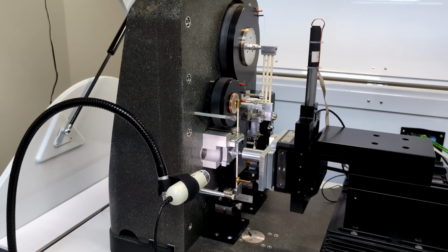As covered in the previous video, the NanoTest Vantage platform has some key design differences from other indentation units that allow it to operate as a multifunction test platform without compromising its nano-indentation capabilities. Instead of being a top-down indenter, as many other platforms are, it's a horizontally loading pendulum system. It is this pendulum-based design that allows the high energy delivery that's key to impact testing.